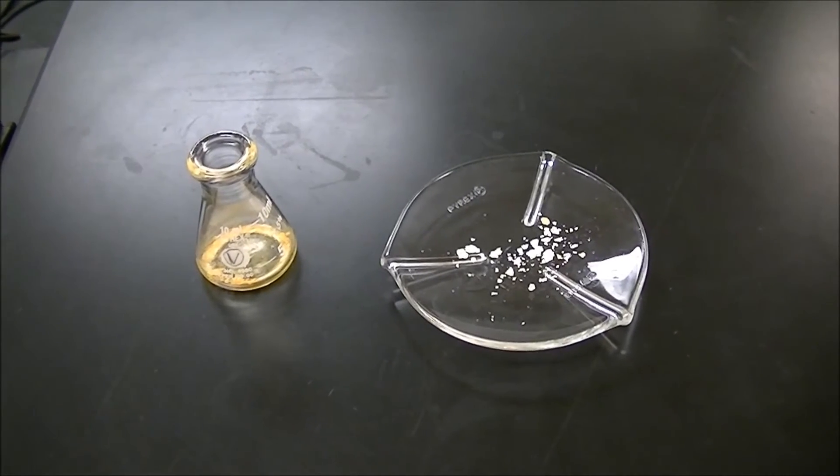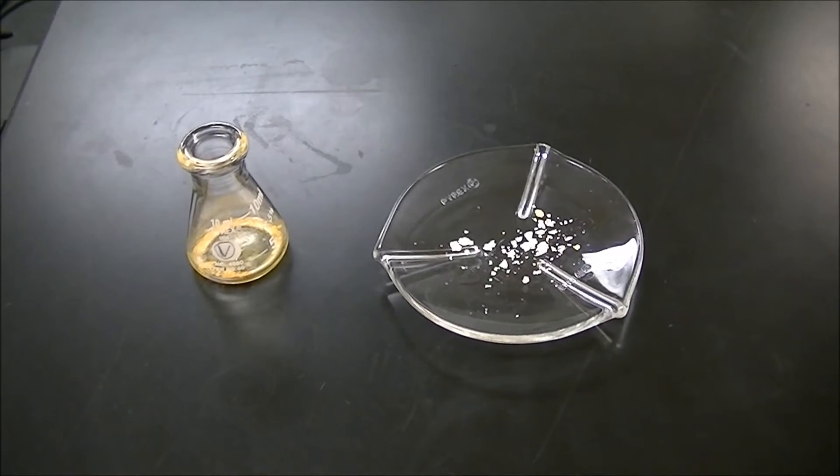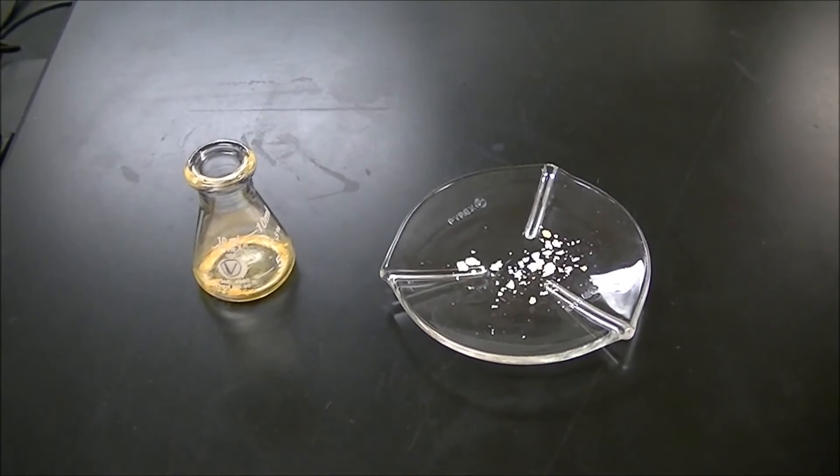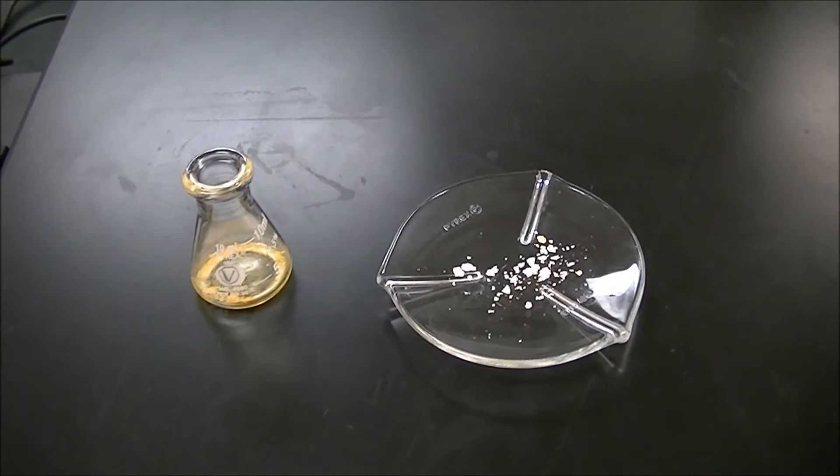Okay, now we have our two solids that we're going to measure the melting temperature for. Measuring the melting temperature tells us something about how pure our product is.